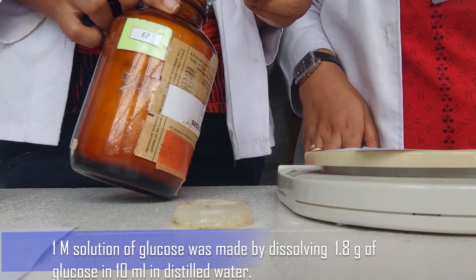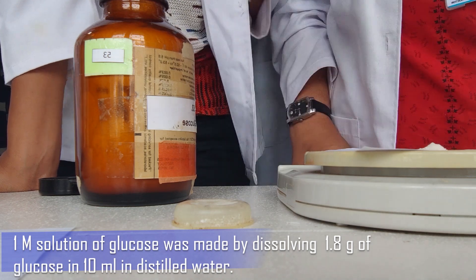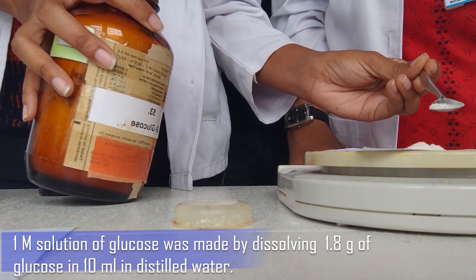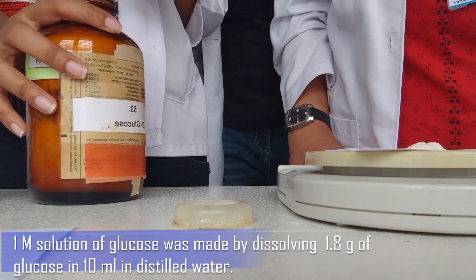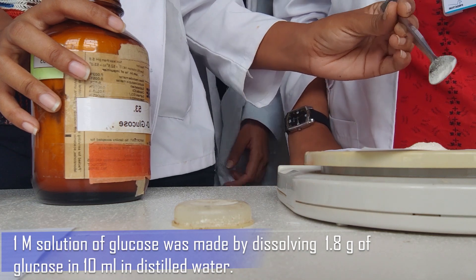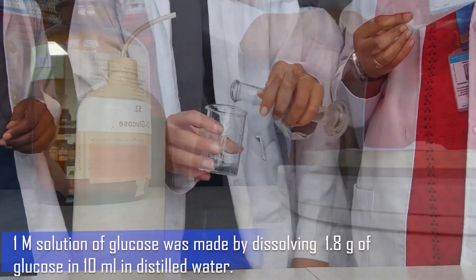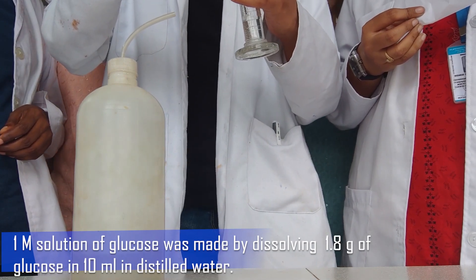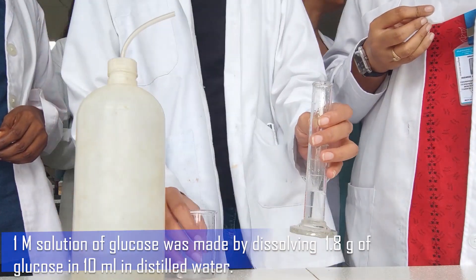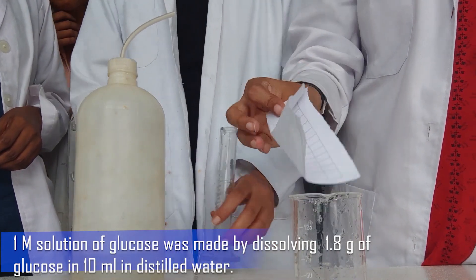Now we will see the procedure. First is glucose dilution preparation. Take 1.8 grams of glucose and weigh it on the weighing machine very carefully. Always remember when you place anything on the weighing machine, first press the tare button. After weighing, take a small beaker.